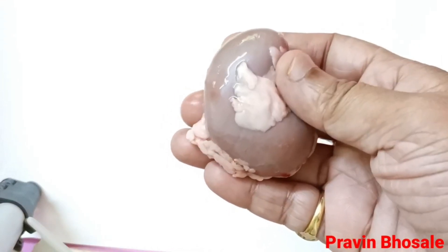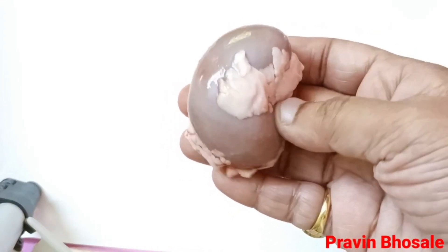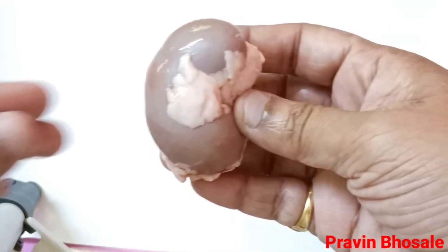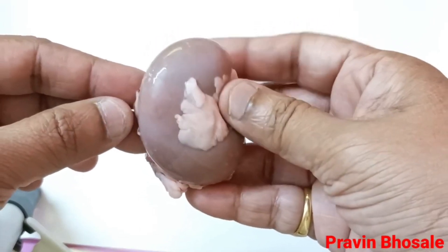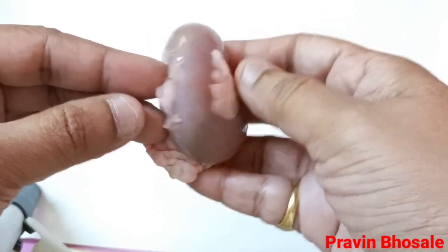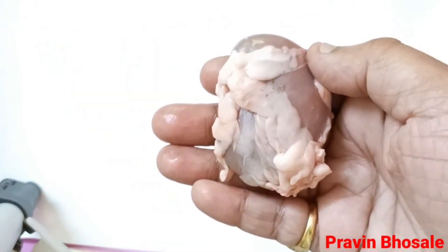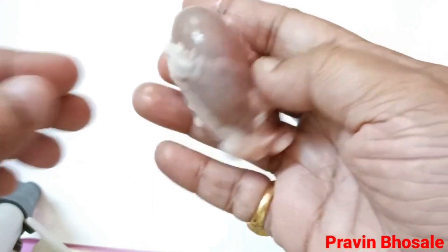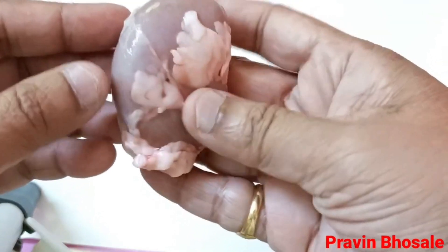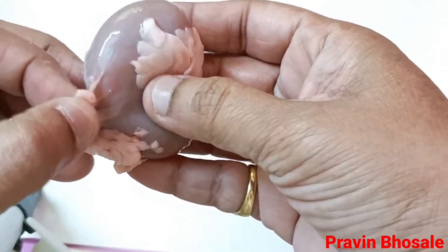Hello students, today I will dissect the kidney of a goat. Kidneys are present in pairs and each kidney is a bean-shaped structure. Kidneys are filters of the body.